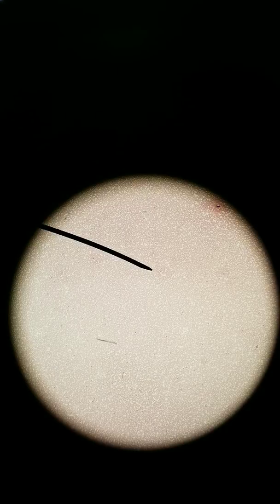It just looks like a bunch of dots, because it is. See all those little dark dots every so often? Those are the white blood cells. The ones without dark purple dots, those are the red blood cells. How do I know that? Red blood cells, erythrocytes, don't have any nuclei. Early in development in the bone marrow, they spat them out, they expelled them. By not having a nucleus, red blood cells become round and disc-shaped, so they're flatter.